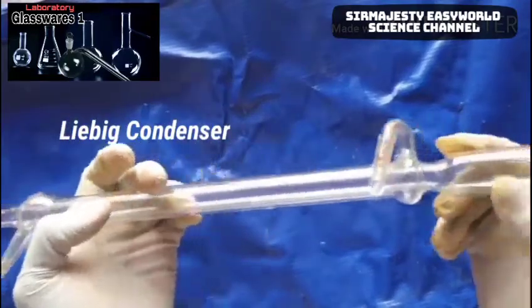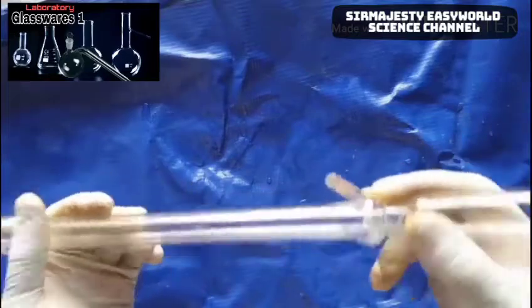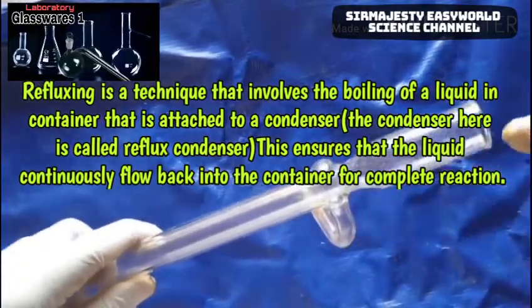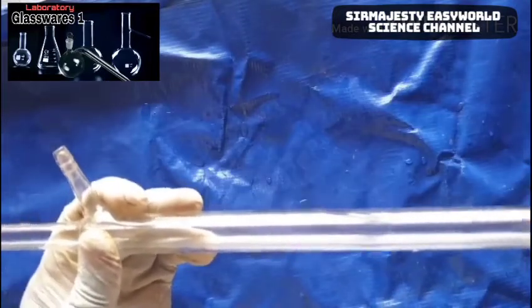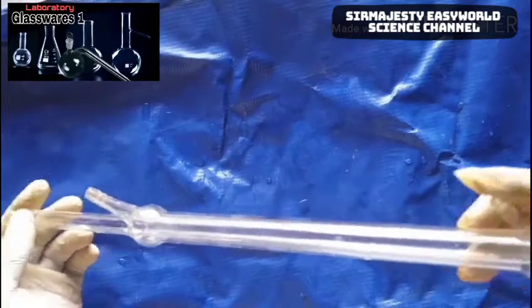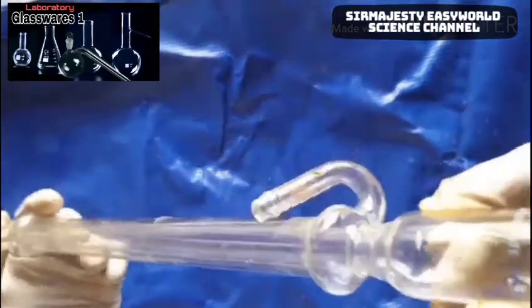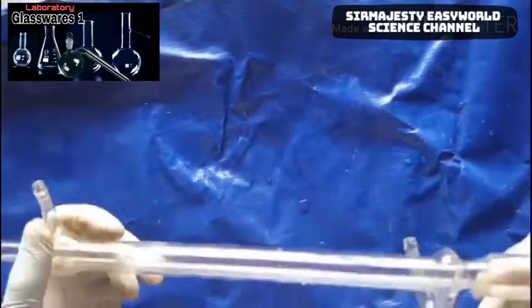This is the Liebig condenser. There are different forms of condenser, but the Liebig condenser is used to convert vapor to liquid. It can also be used for refluxing — so it can serve as a reflux condenser. Refluxing is when you need two reactants to remain together for a long time to ensure complete reaction, such as during the oxidation of ethanol with K₂Cr₂O₇ to produce ethanoic acid. Without refluxing, ethanol would only be partially oxidized to ethanal, but with refluxing it is completely oxidized to ethanoic acid.